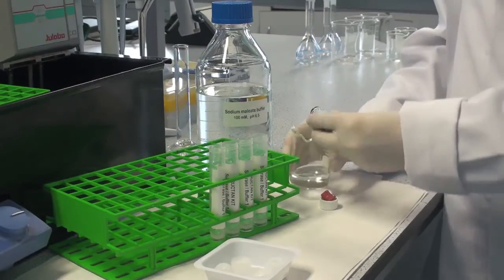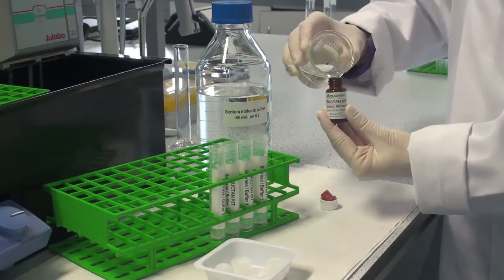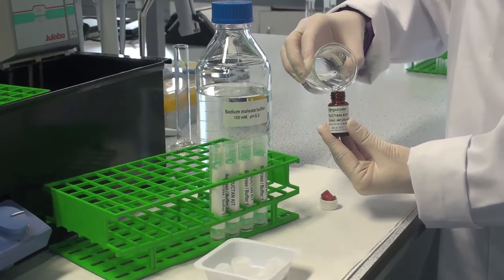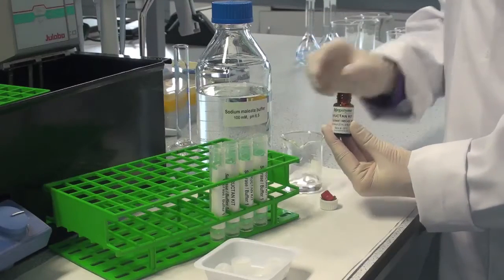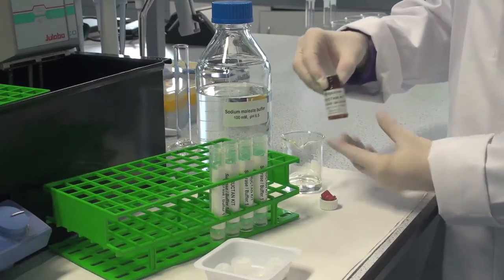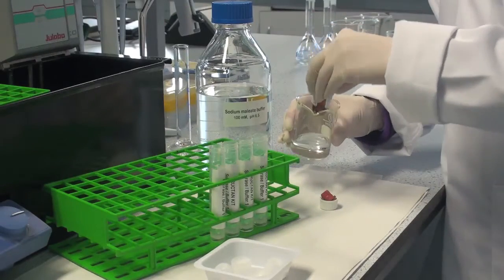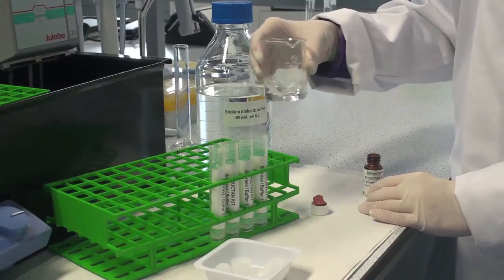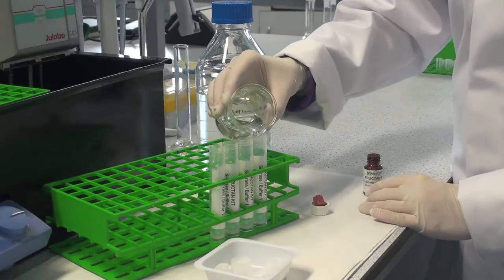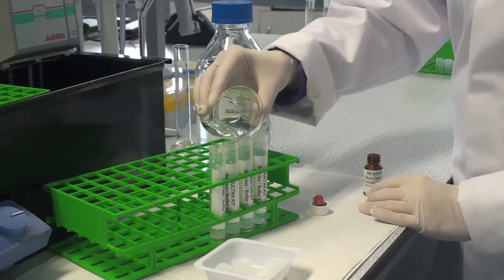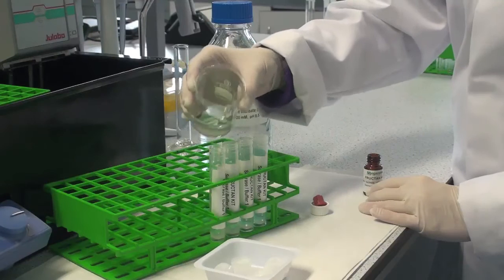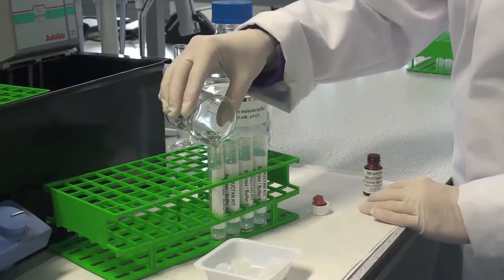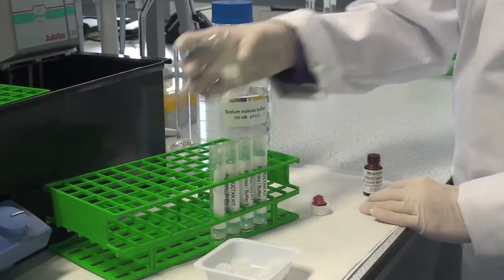Take care to dissolve all of the enzyme from the bottle. Divide this into aliquots of appropriate volume and store at minus 20 degrees centigrade. This enzyme is stable in polypropylene containers for greater than 5 years at minus 20 degrees centigrade.